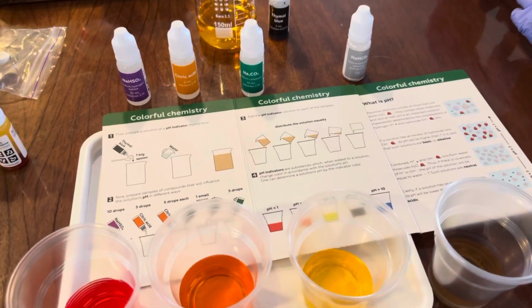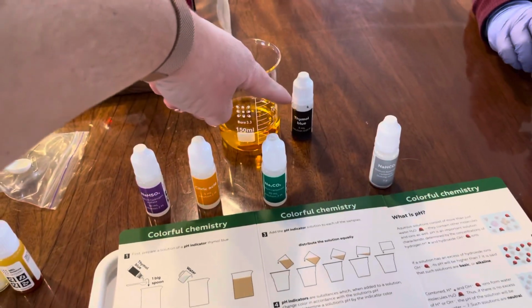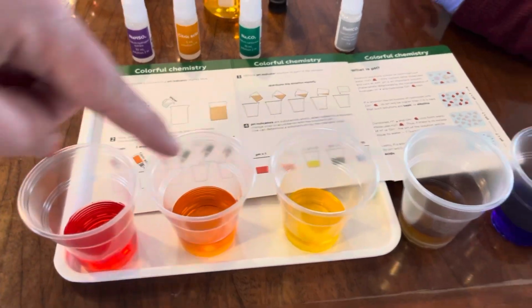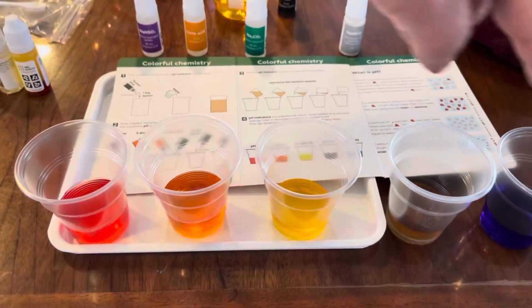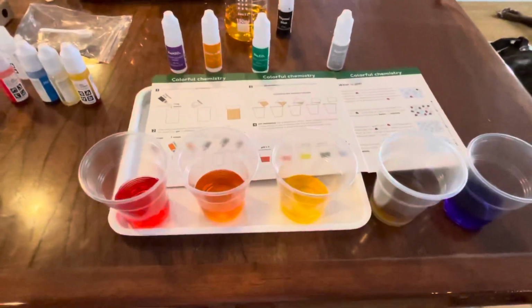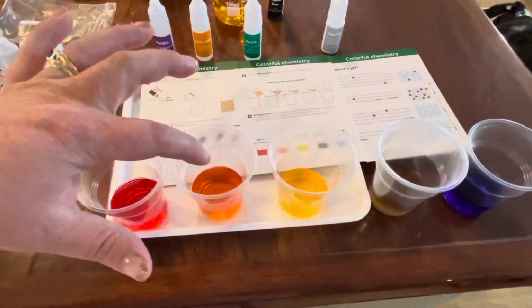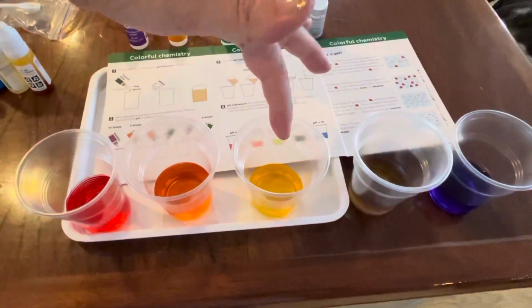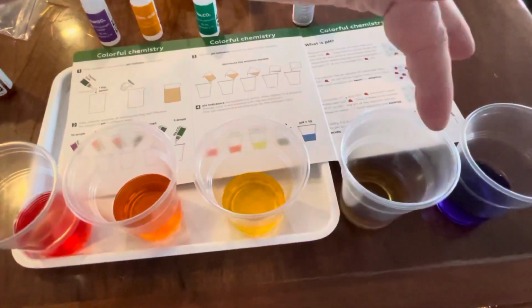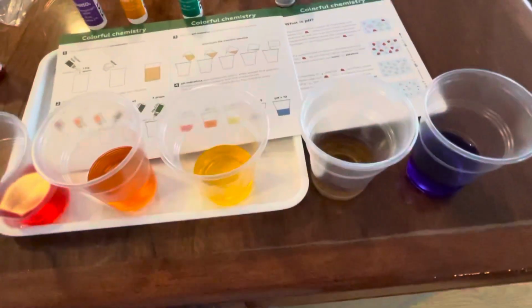All right, so when we look at pH, when we first prepared our indicator, that's what we did here. We had our thymol blue and then we just added water. Then we added solutions to all of these to be able to create acidic and alkaline solutions. In this one, we added your NaHSO4, citric acid, and then the citric acid and the Na2CO3, and then we added our baking soda, our NaHCO3, and then we added the Na2CO3 here.